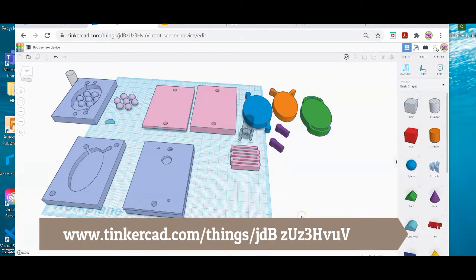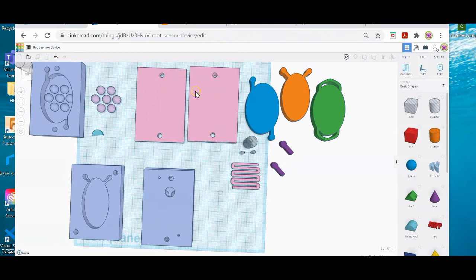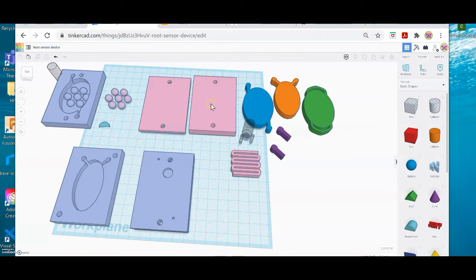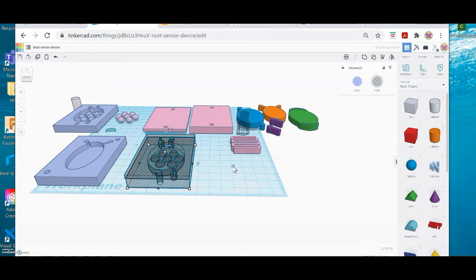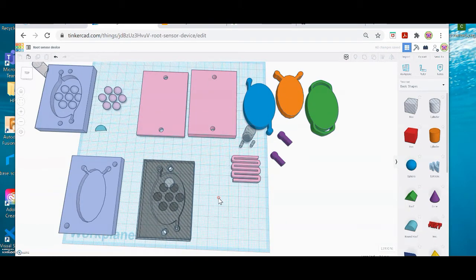Okay, so moving on to Tinkercad, I wanted to show you the template we'll be using. And basically what you're going to be doing is, I want you to think of this kind of like making a chocolate mold. The cavity in which you're going to grow your roots is going to be on this base plate. And then this one next to it is the lid. And what's going to happen is you're going to slide the lid on top of your base plate design. I'm just going to turn this example one here hollow so you can see what it looks like. So that's an example of a completed one.